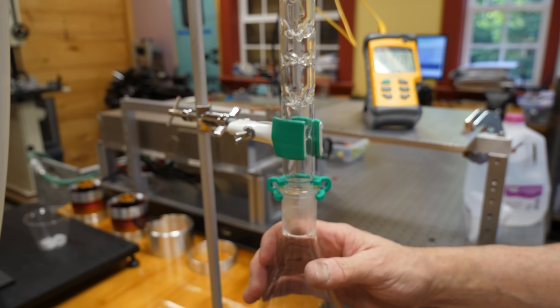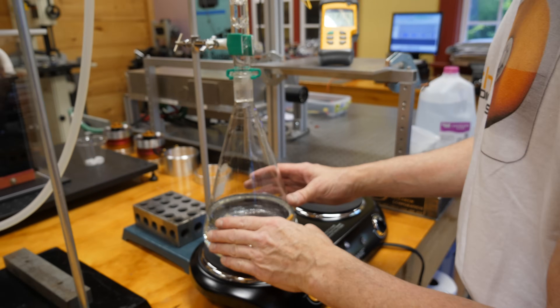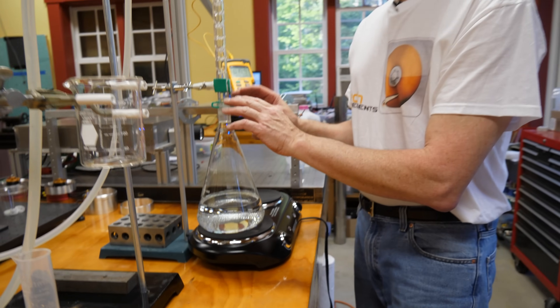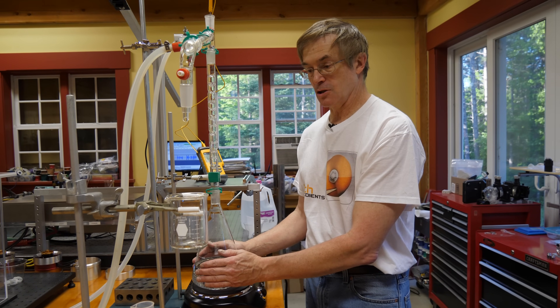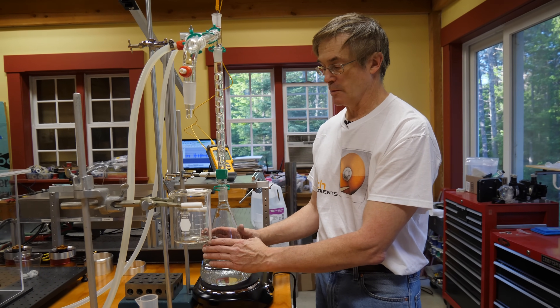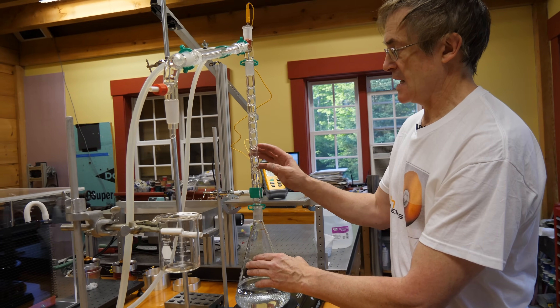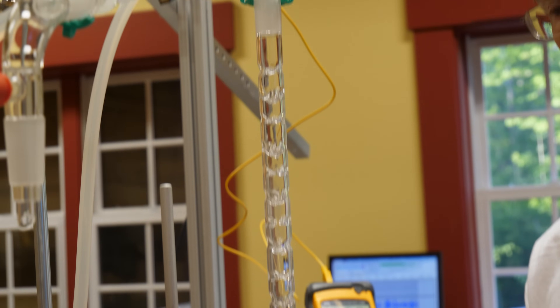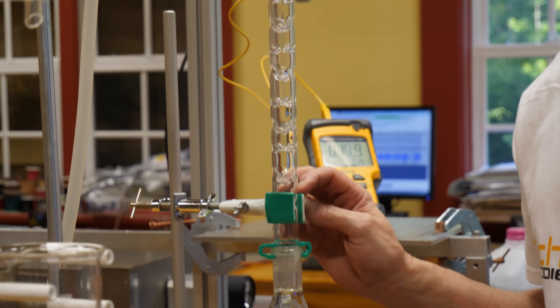We'll put a clamp on here to keep things together and make sure it's fixed securely onto the hot plate, then turn the heat on. This will take a couple of minutes to warm up. What's going to happen is we'll begin heating the two liquids together, the vapor pressure will begin to increase, and then an interesting process happens in this long reflux column called the Vigreux column — I'll explain that in just a moment.